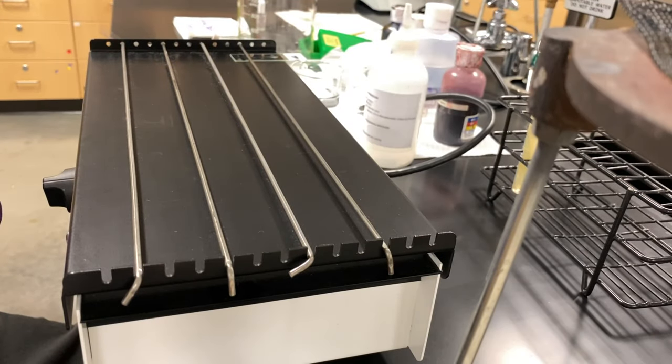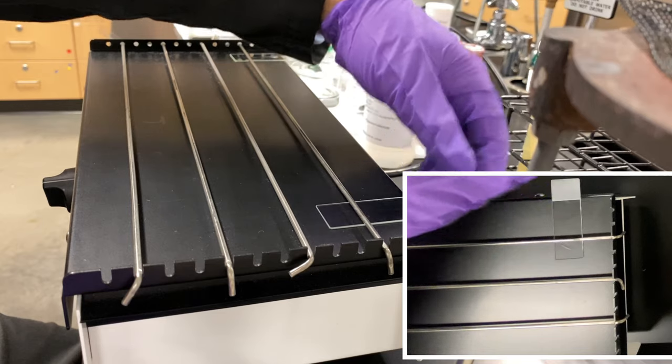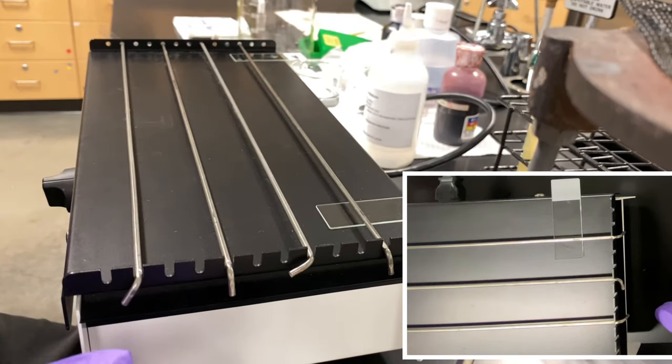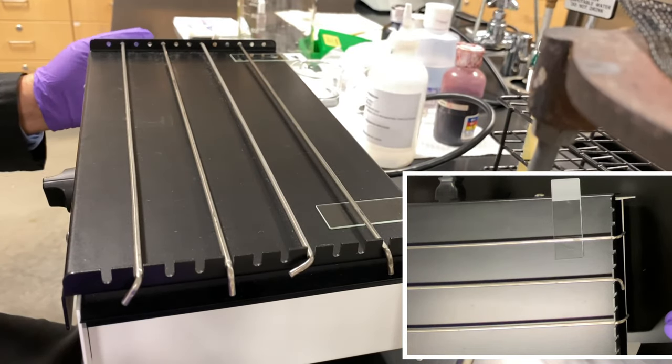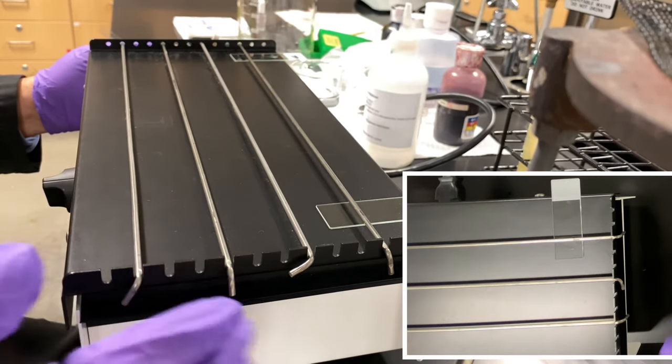We use bench heaters to actually create smears. I already have a slide happening, but I created a new one just so we can do this. We usually just place it on the actual surface and within about a minute or so, the fluid that is in there will dry out.